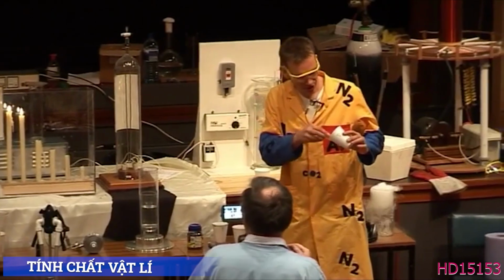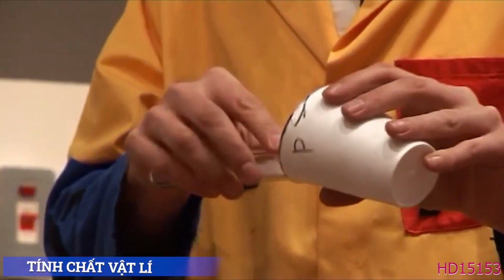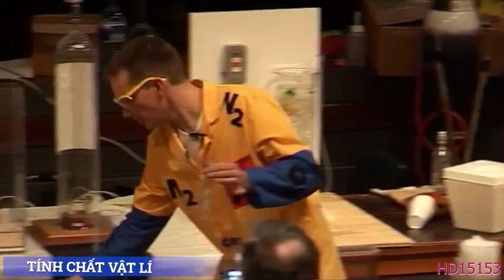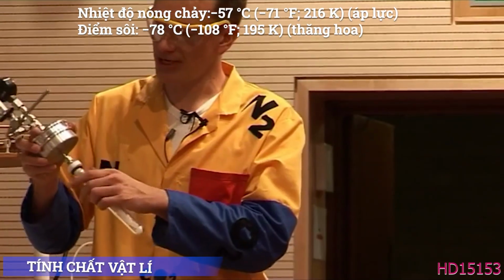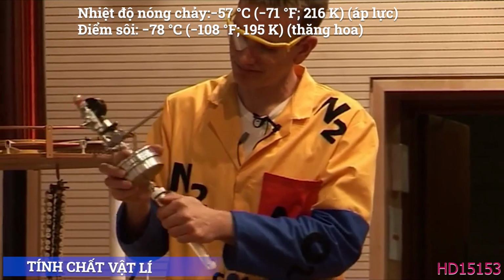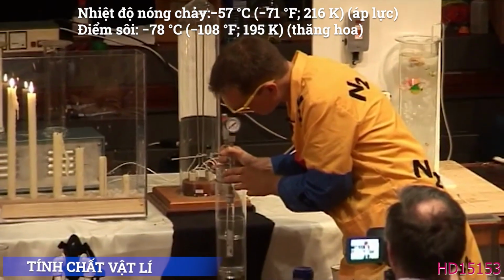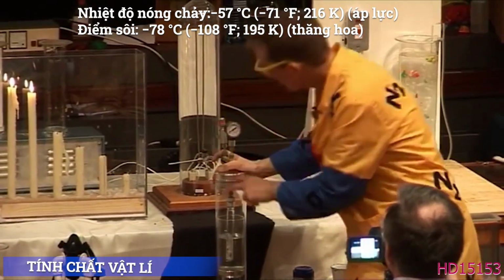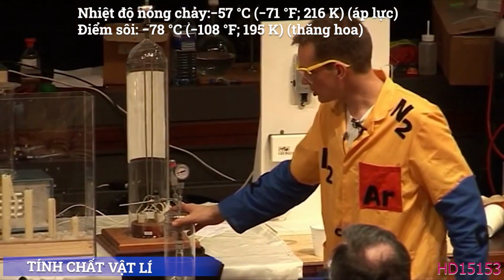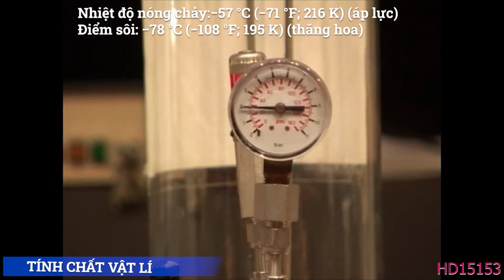I'm going to put some of the solid carbon dioxide into this very, very thick-walled test tube. There we are. So here I have some solid carbon dioxide in the test tube. I'm going to put the lid on this and do it up. And put this into some water here, so it doesn't frost over. Now, what's going on here? The solid carbon dioxide is turning straight into a gas, and you can actually see the pressure building up inside this test tube. There's nowhere for the gas to come out.